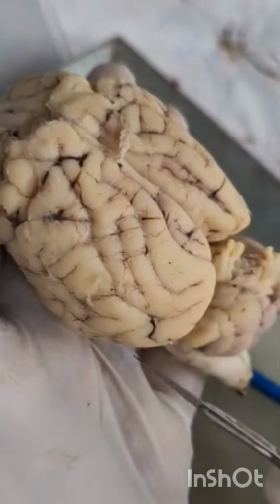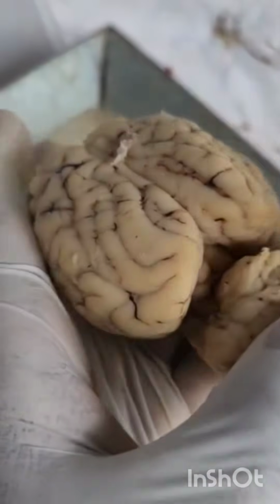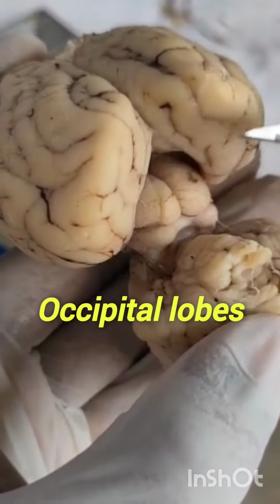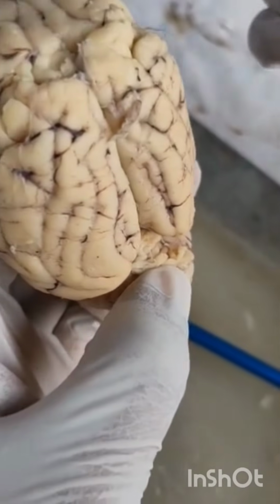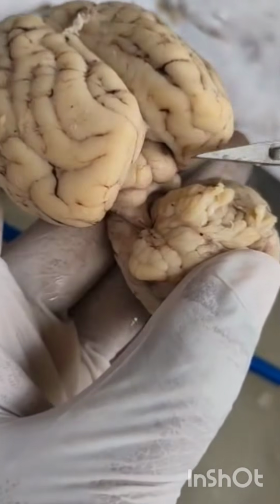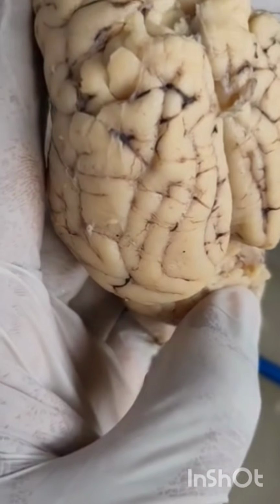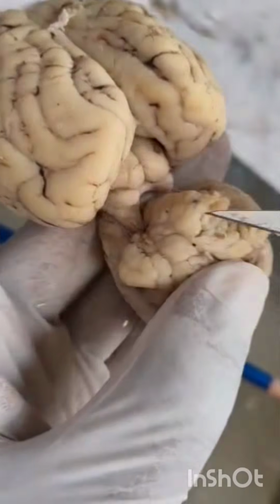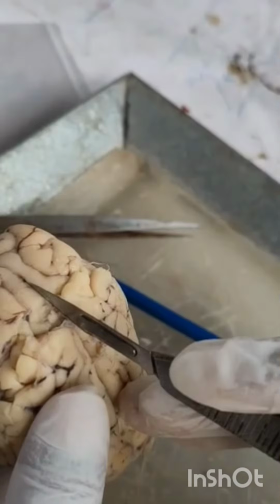And these 2 lobes are called occipital lobes: frontal, parietal, temporal, occipital. So again, frontal, parietal, temporal, and 2 occipital lobes. Like this, 4 lobes are present.